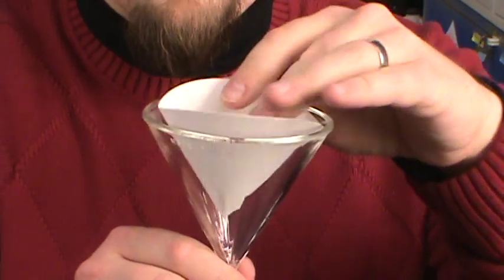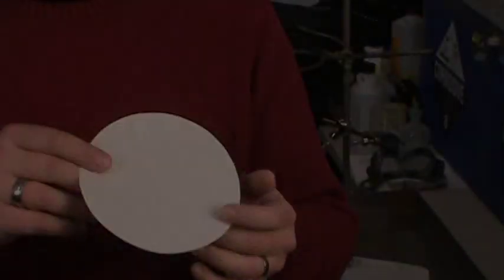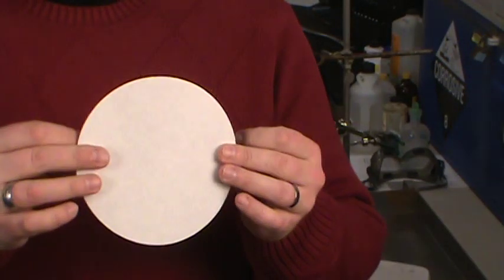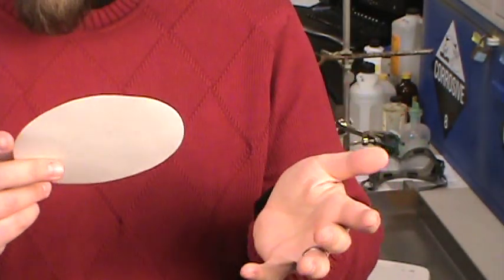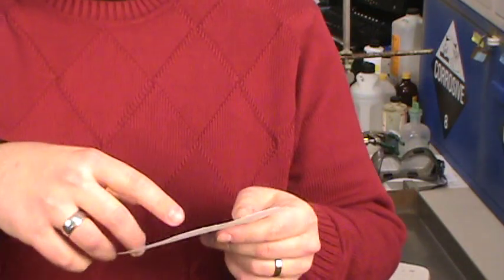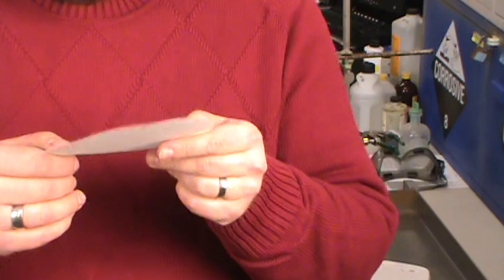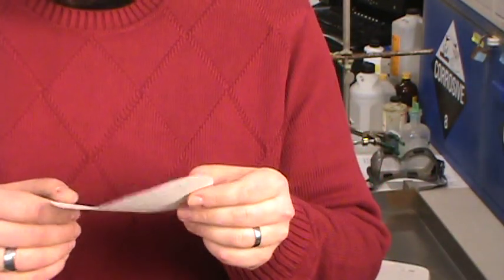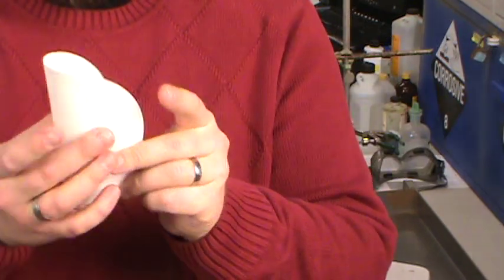The other option starting with this flat filter paper is a fluted filter paper. Now fluted filter papers have a few advantages - they've got more surface area so they tend to drain a little bit faster, but they take a little bit more folding and they're really not necessary for a lot of things that people do.